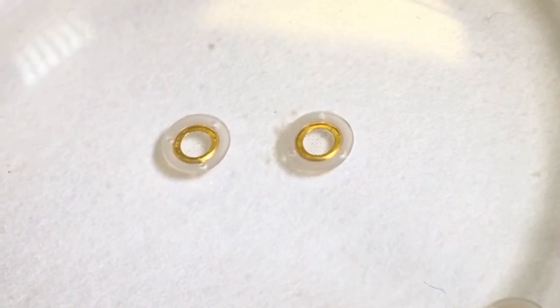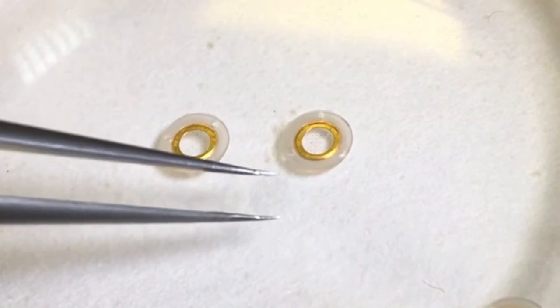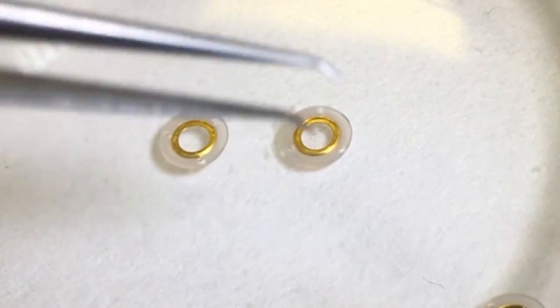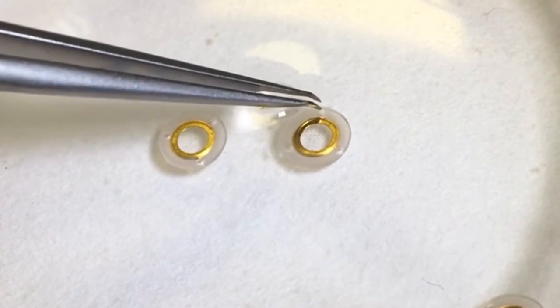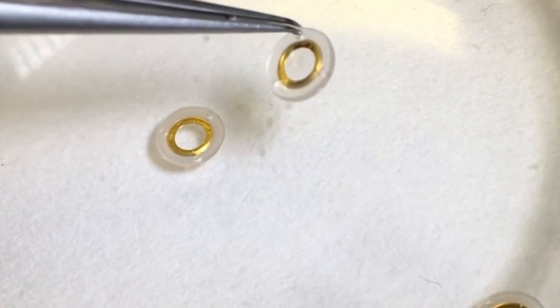What you will do then is get a covering sapphire disk like this one, which fits exactly inside the capsule where you can drop the sample. This means your samples will be isolated between the sapphire disk of the cryo-capsule and the covering sapphire disk.